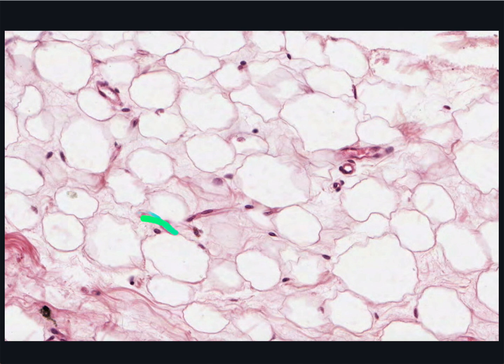Capillaries are just large enough in diameter for only one red blood cell to pass through at a time. The larger structures, big enough to hold 2 or more blood cells abreast, but still with only one layer of flattened endothelium in their wall, are of course going to be venules.